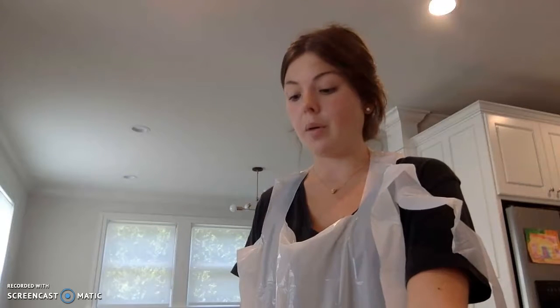Emma Kate Burden. Hi, I have just completed the sheep brain dissection. I am going to go over some of the main parts of the sheep brain with you today.